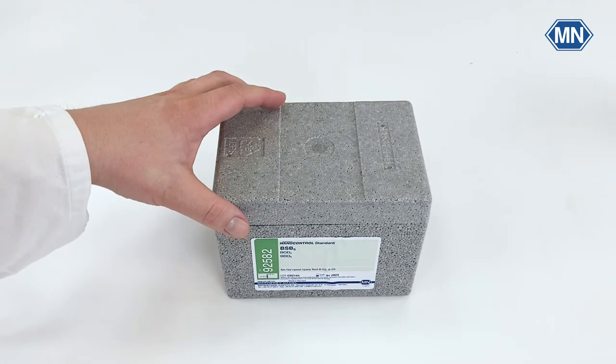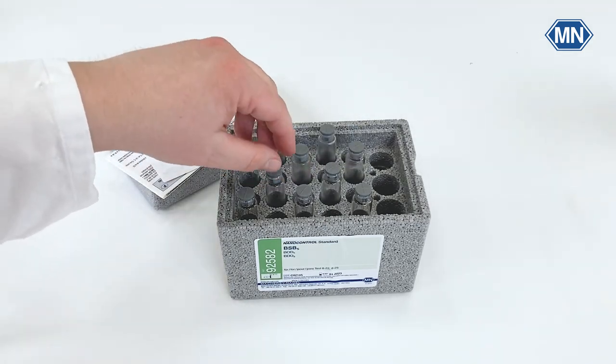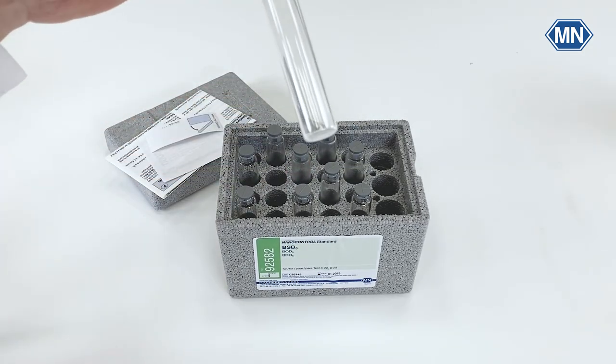Analytical quality control can be done with the NanoControl BOD5 standard solution. For measurements with this standard solution, you will need inoculated dilution water.